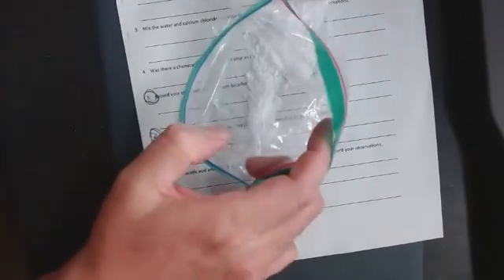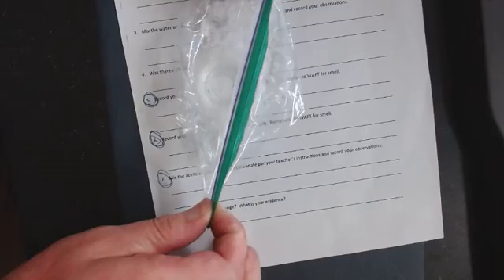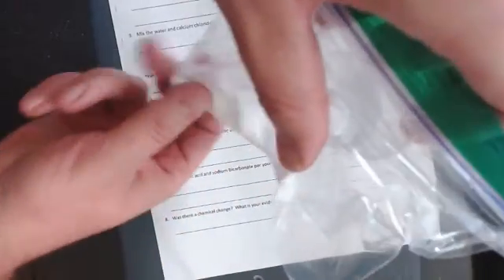Here in the reaction, I had the student open up their bag, put the cup in the bottom of the bag and zip up their bag, just like that. Once it was zipped up, they picked it up, and I told them to make sure they feel the chemical when we mix it.